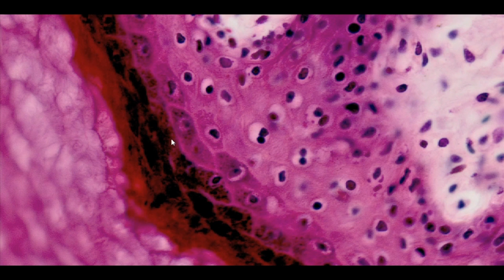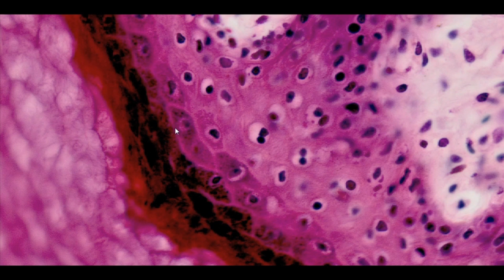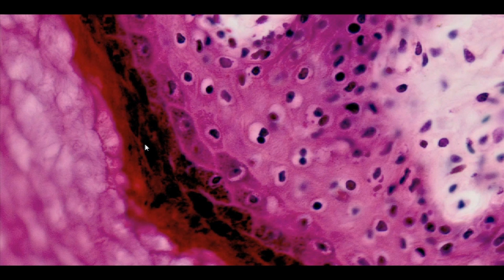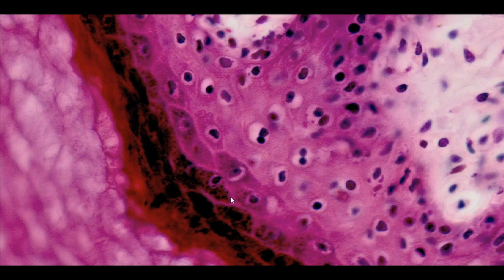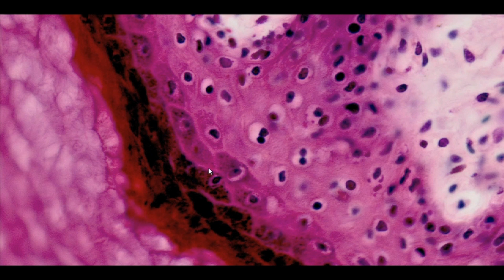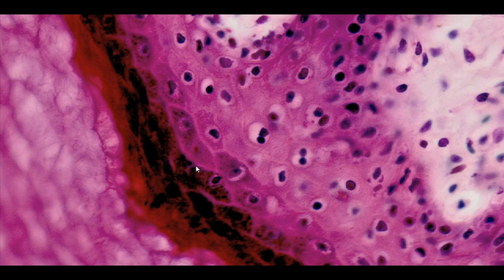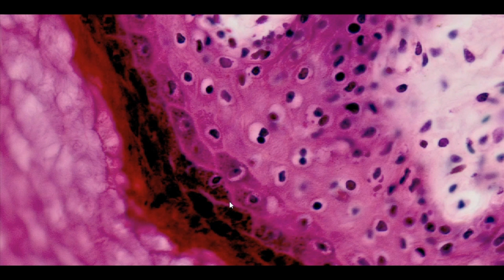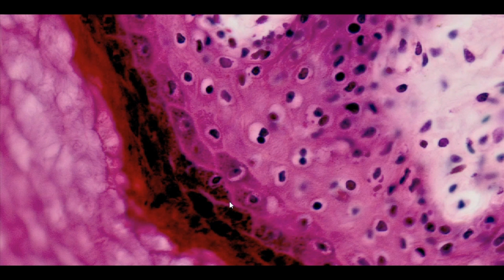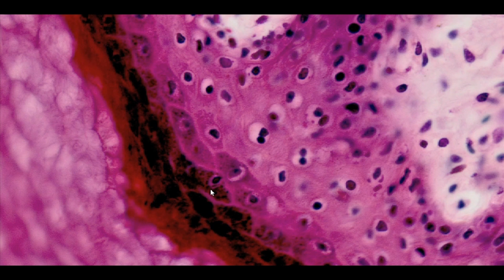The stratum granulosum is made up of three to five layers of flat cells. In the presented cross-section, they are visible as spindle-shaped cells arranged with their long axis parallel to the epidermal surface. The granule cell layer owes its name to multiple basophilic granules present in the cytoplasm.